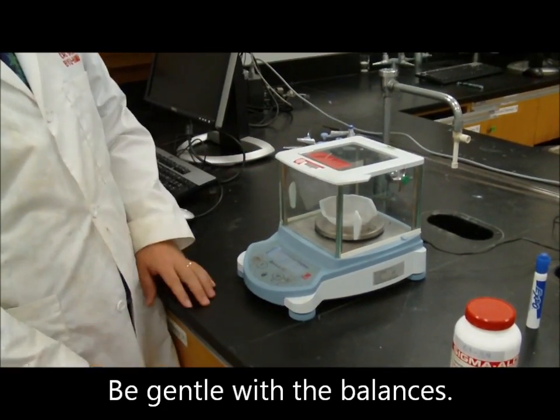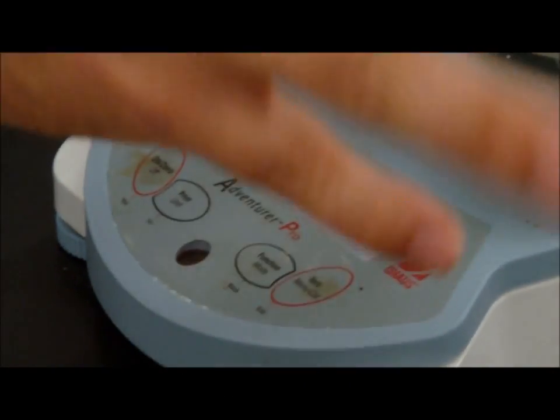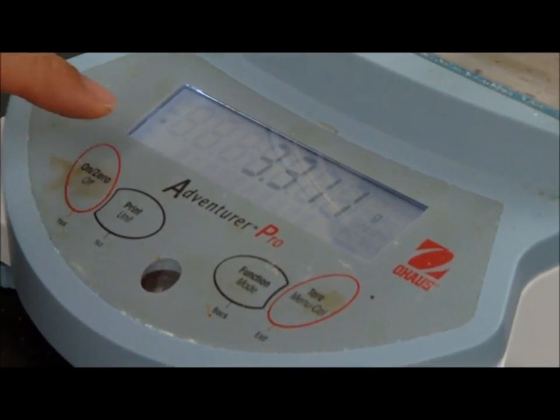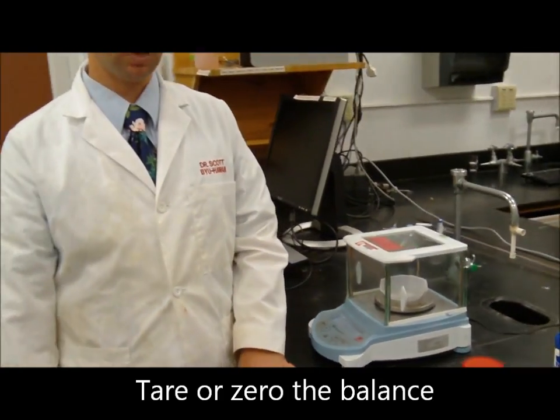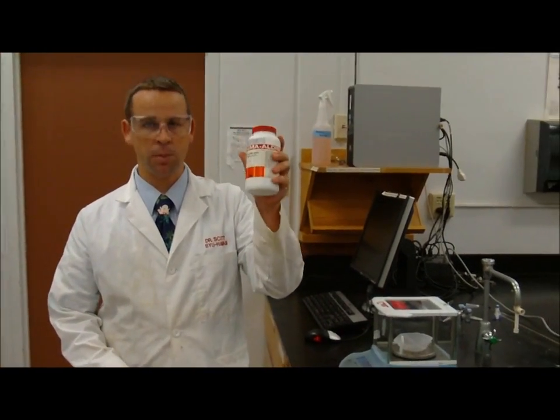All right, I've placed the weigh boat onto the pan. I see a mass here. I'm not interested in that mass. I'm interested in what I'm going to put onto it. So therefore I can tare the balance, and now it'll say 0, and now it's ready for me to add some chemical of some kind. Okay? My chemical that I'm going to be working with here in a bit is called copper sulfate.